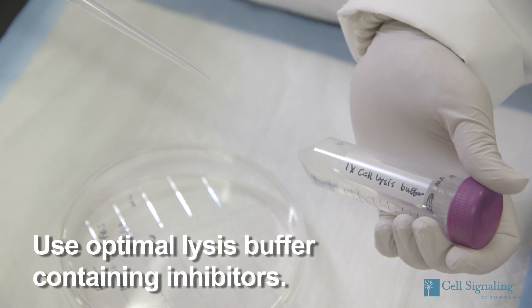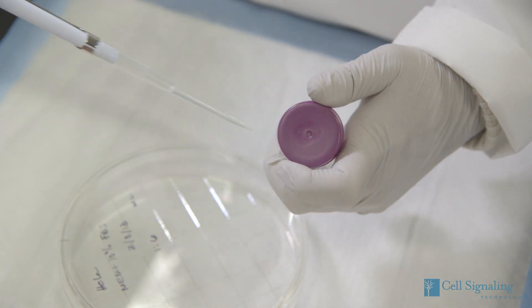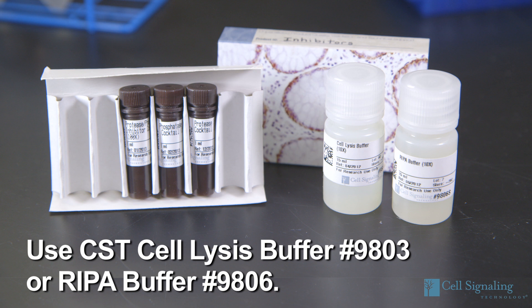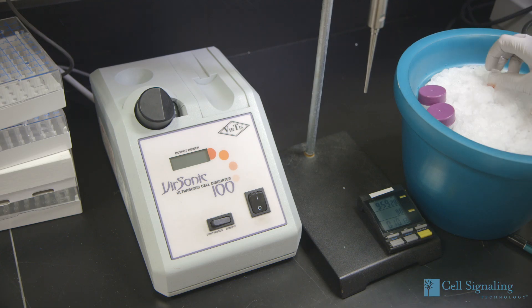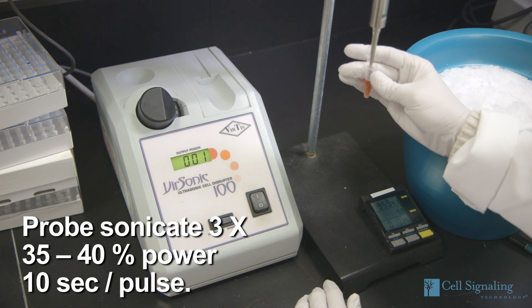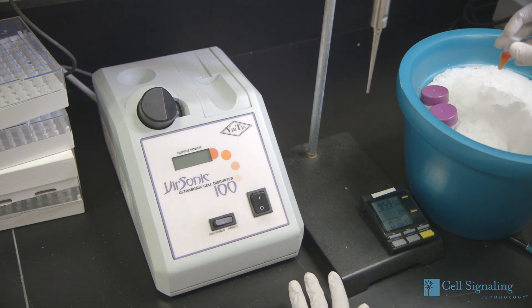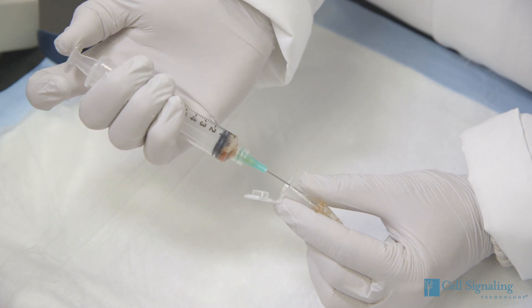Secondly, undetectable protein can be caused by suboptimal sample preparation by not using the recommended lysis buffer with the required phosphatase inhibitors. CST offers optimized cell lysis buffers that already contain all phosphatase and protease inhibitors; however, we recommend adding 1 mM PMSF immediately before use. We always recommend sonication to ensure total cell lysis and to shear chromosomal DNA — 3 pulses for 10 seconds at 35-40% power, keeping samples on ice between pulses. If you do not have access to a probe sonicator, you may pass your samples through a fine-gauge needle.